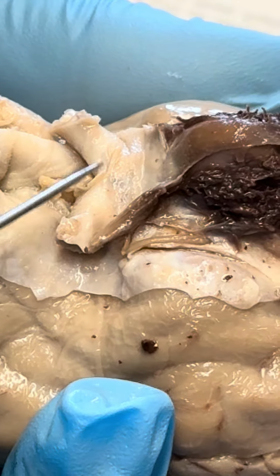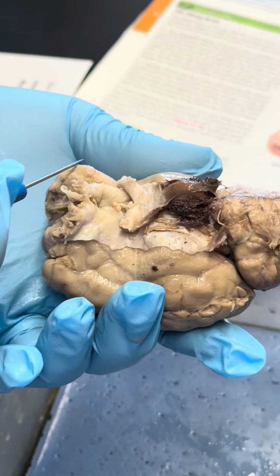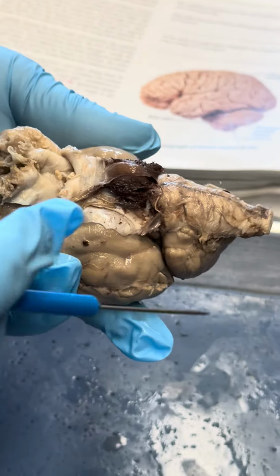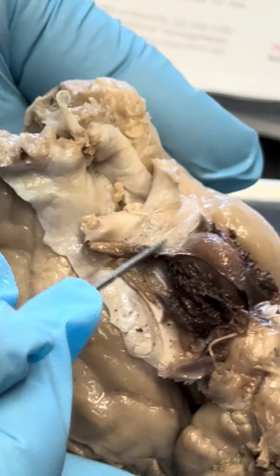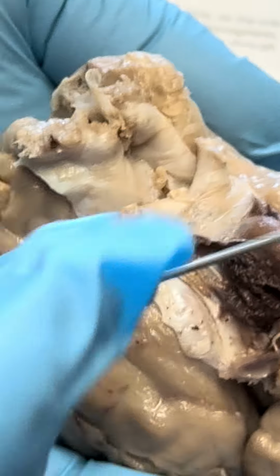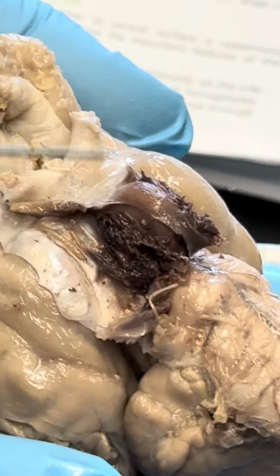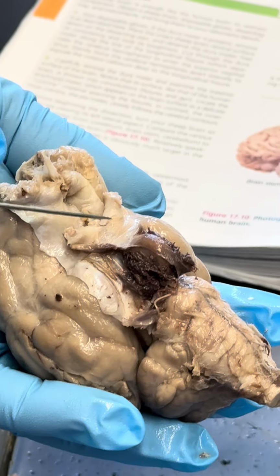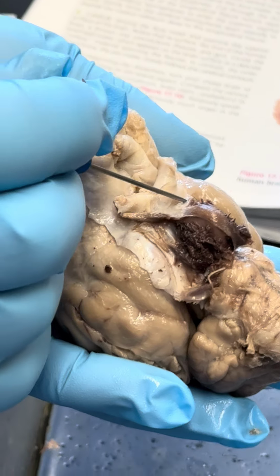meninges. This here is the optic nerve. It goes down here to the eye. Other optic nerve goes to the other eye. And we have here the optic chiasma. It is still covered by the meninges, but there the optic nerves cross, so both of the optic nerves cross, and then this is what we call the optic chiasma, and that then will become, the optic nerve will become the optic tract.